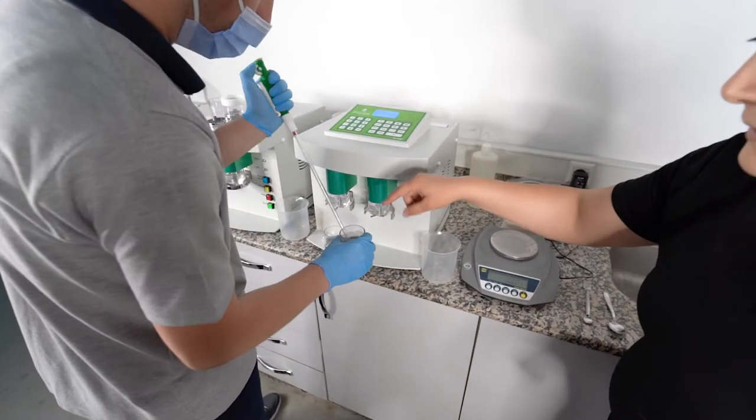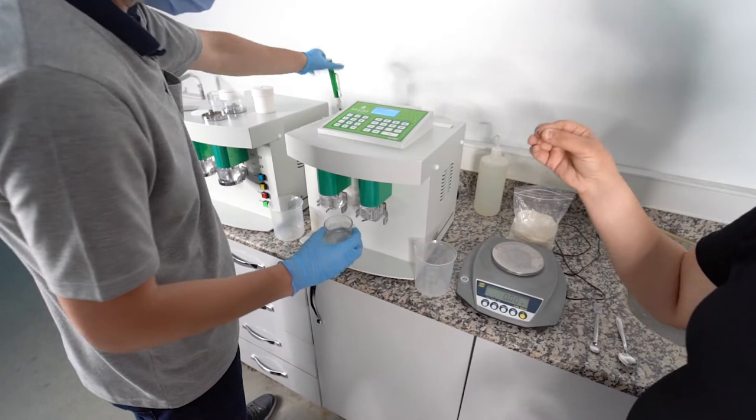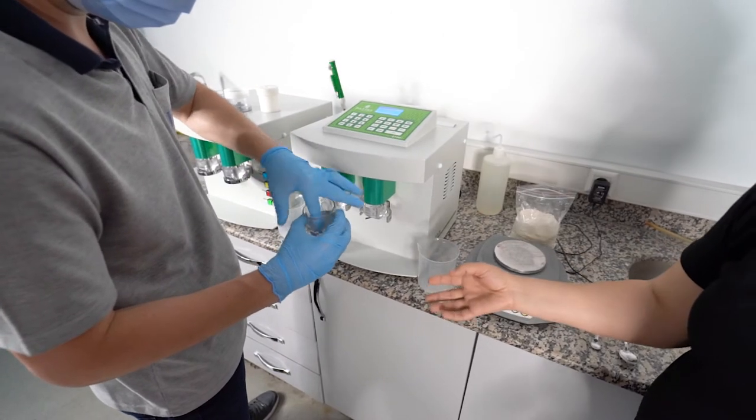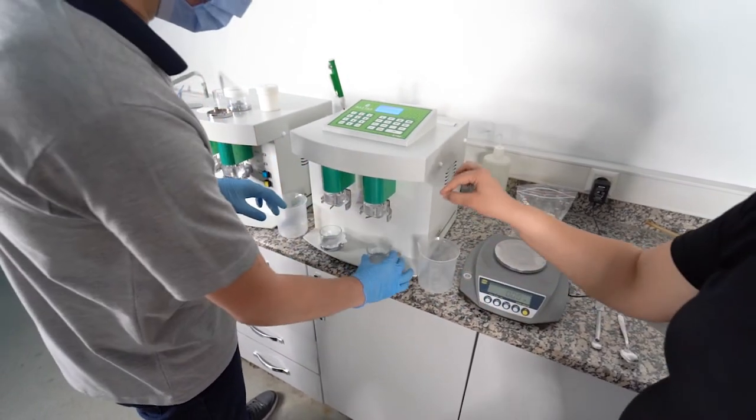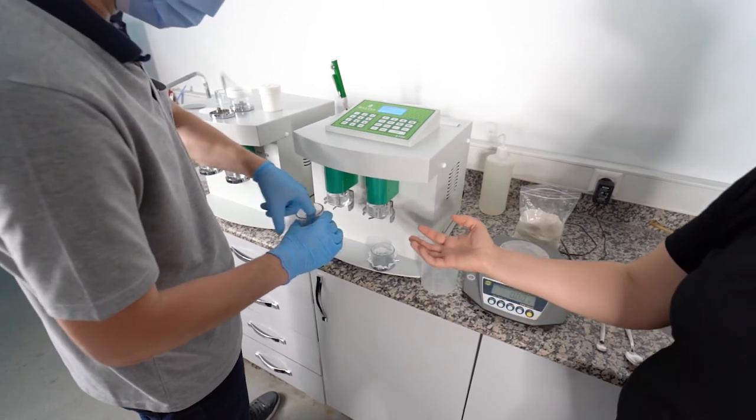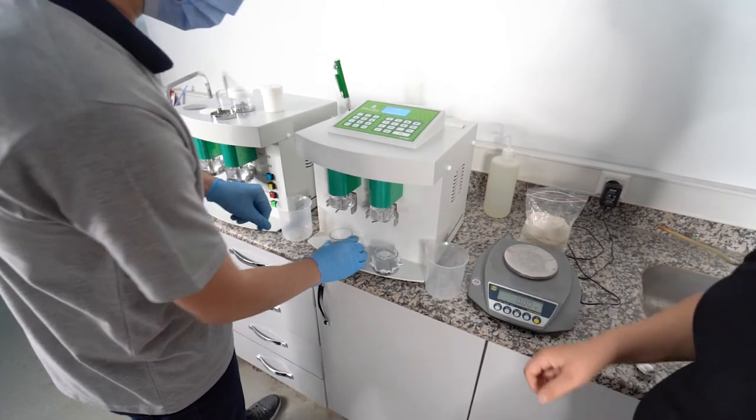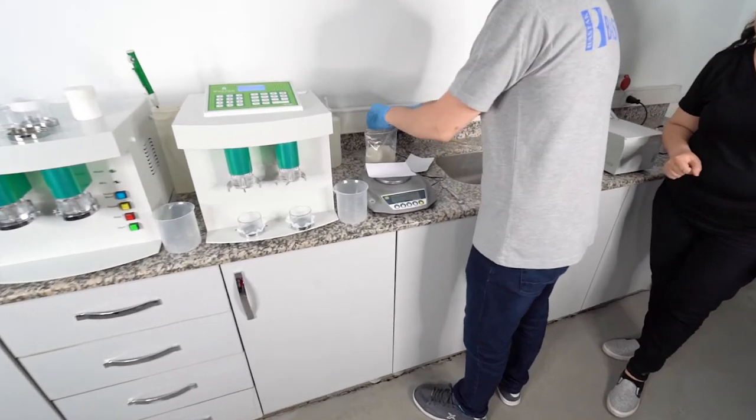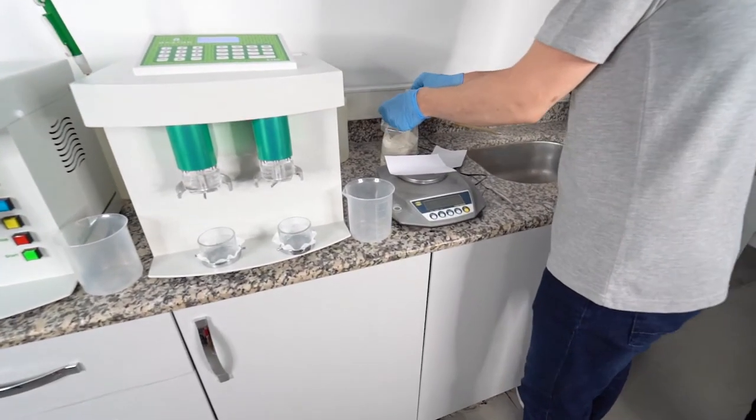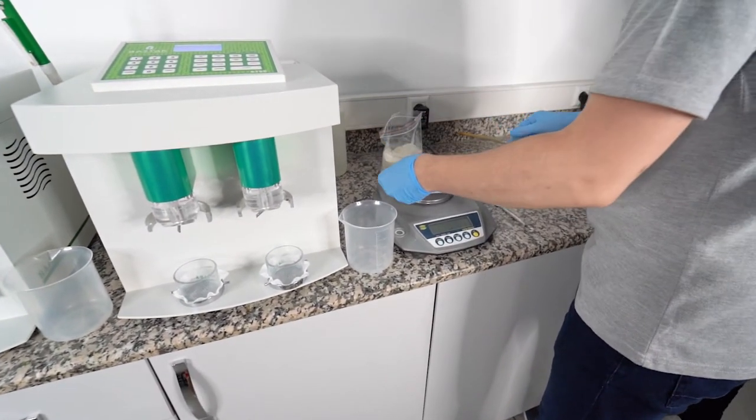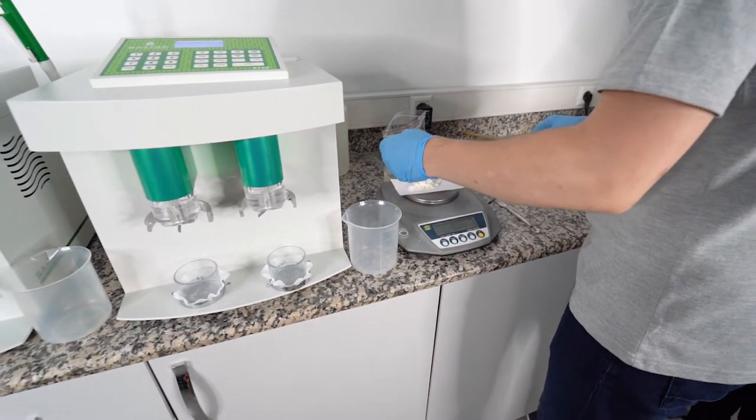First we are adding a little bit of water, otherwise your sample goes through the sieve. This moisture will hold your sample inside the gluten washer chamber. Now my friend is weighing 9.94 gram sample. We are working as parallel.